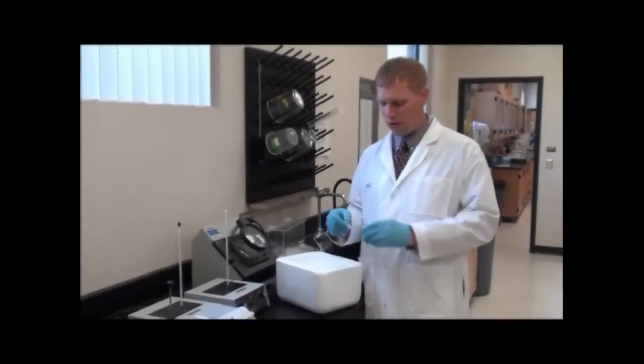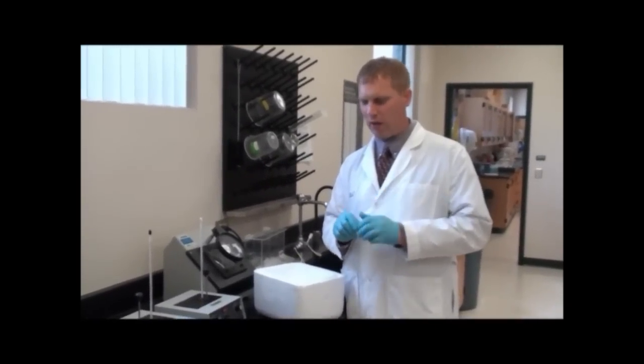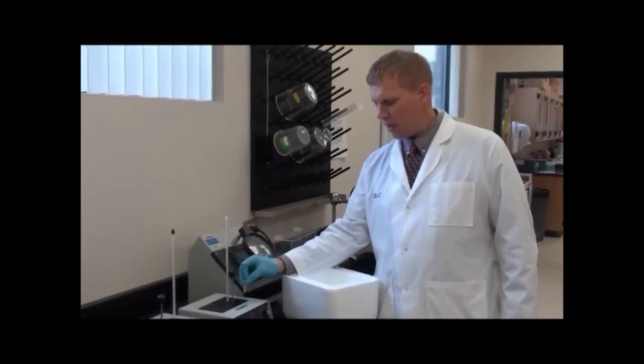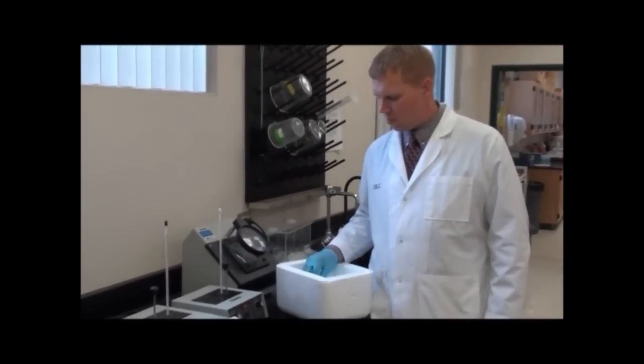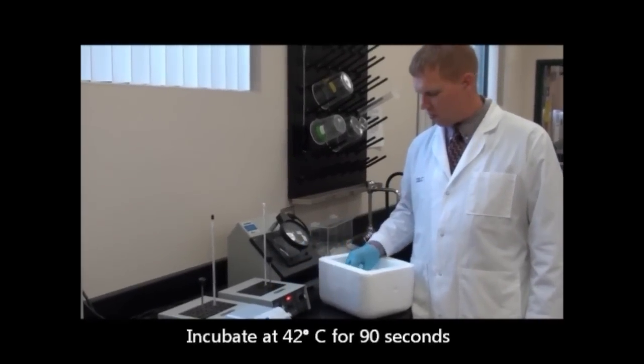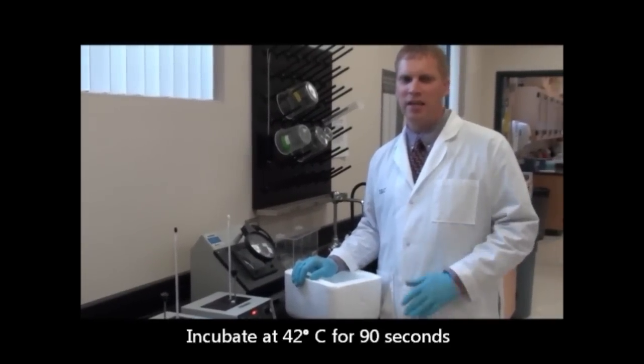It's been about a half hour, and our DNA has been incubating with our bacteria on ice. Now we're going to perform the heat shock. I'm going to place my sample directly from ice into the heat bath at 42 degrees that we prepared here, and we're going to wait exactly 90 seconds.